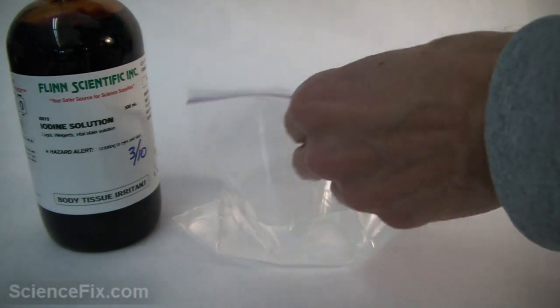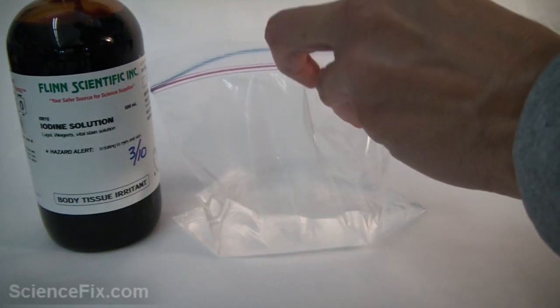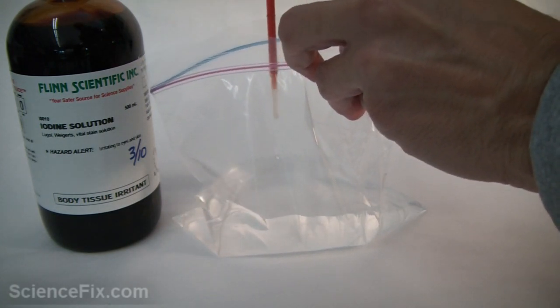Here is a bottle of Lugol's iodine solution. We are going to put some of that Lugol's iodine solution into a bag that has water in it.